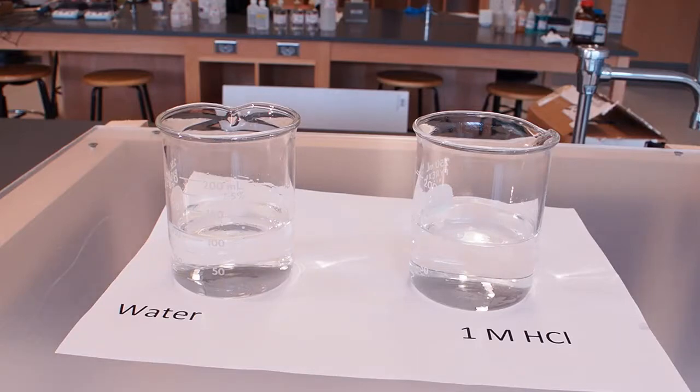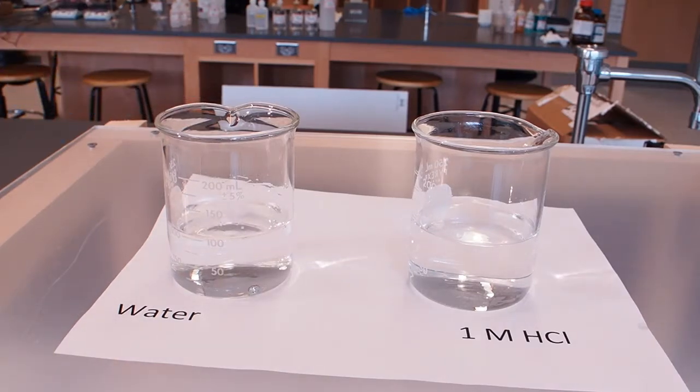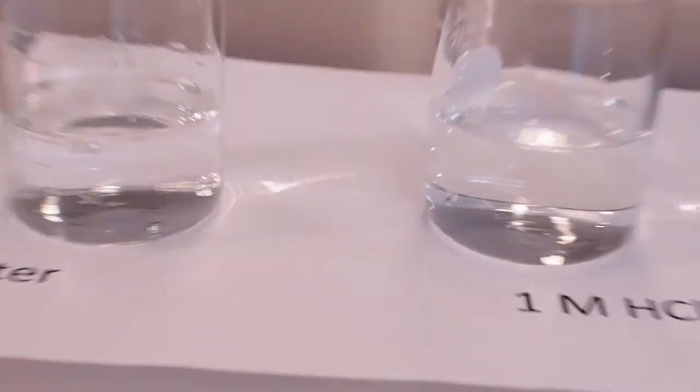We are now ready to try to dissolve gallium. And we're going to start by putting it in water. And then if that doesn't work, we'll put it in hydrochloric acid. So we have one of our little ingots that we made. We're going to add that to the water. And it appears to not be doing anything.